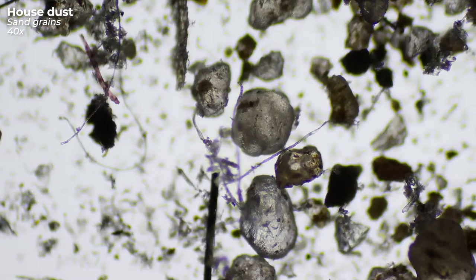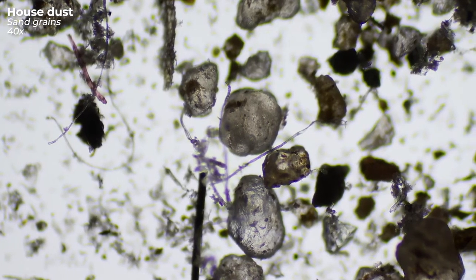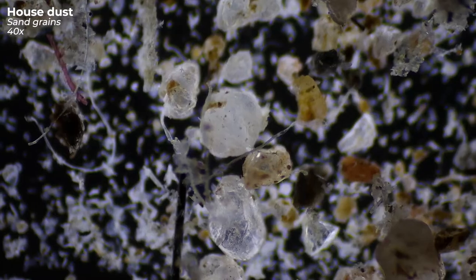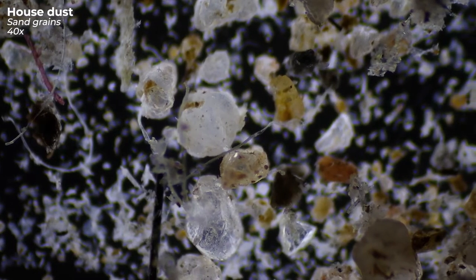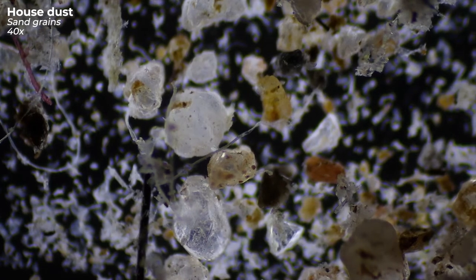For some recordings I will use a dark field filter, as seen here. This increases the contrast and some details become more visible.